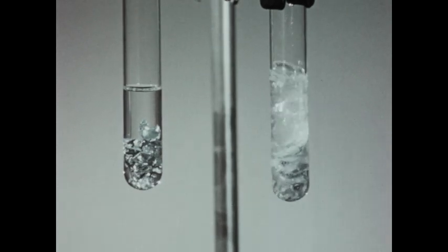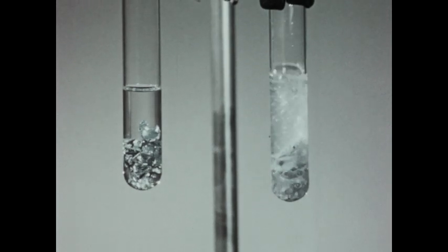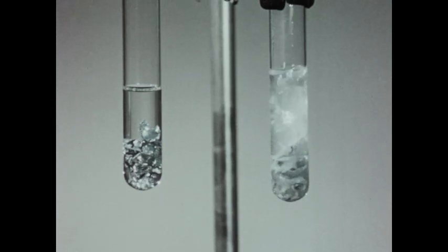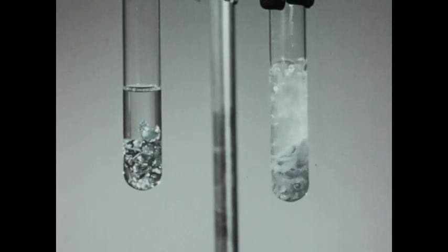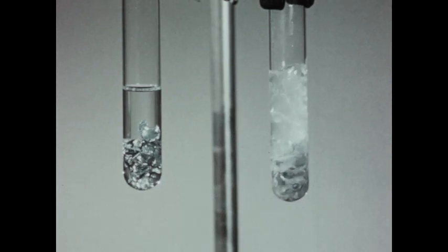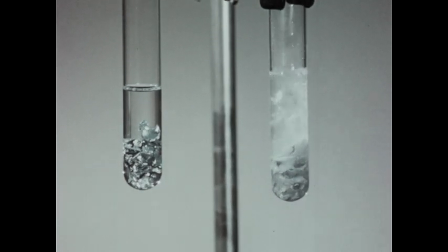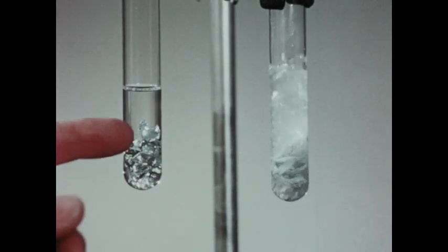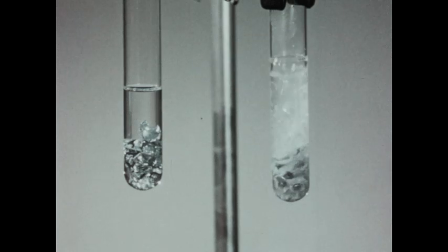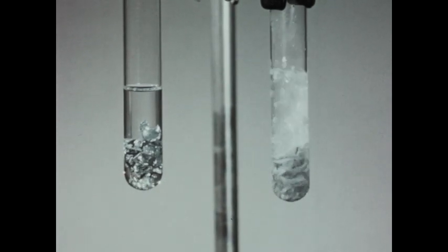You can see a very definite difference in the rate of reaction. This illustrates a rather general property: because other things being equal, ionized solutes will ordinarily react more rapidly than molecular solutes. We see an example of this phenomenon in the reaction of acetic acid and hydrochloric acid with zinc—the ionized acid reacting rapidly, and the weakly ionized acid reacting very slowly.